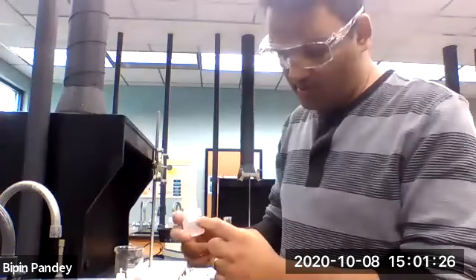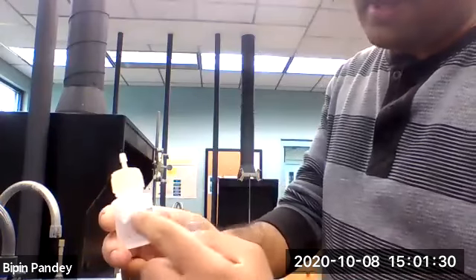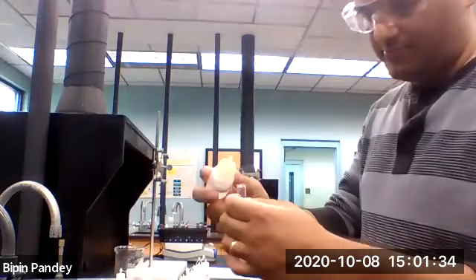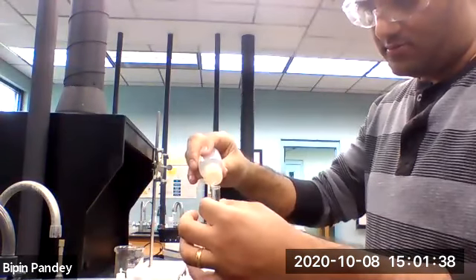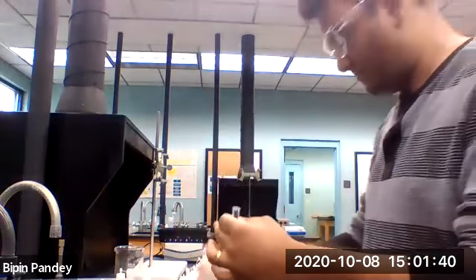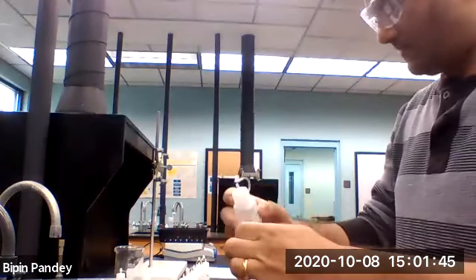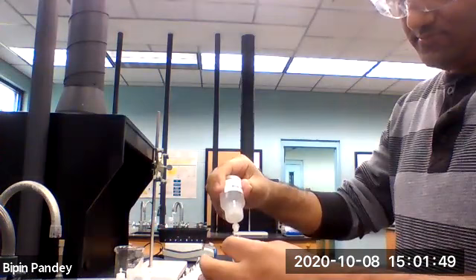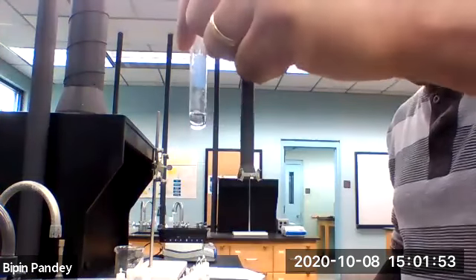Alright, next we are going to use lithium chloride. Lithium is my cation, and I'm going to add it to my anions. 5 drops of lithium chloride, 5 drops of sodium chloride.